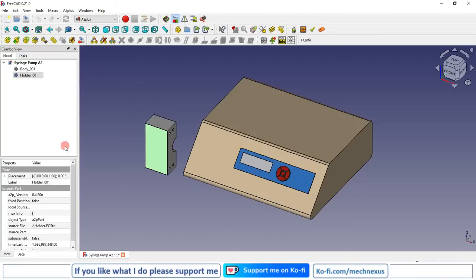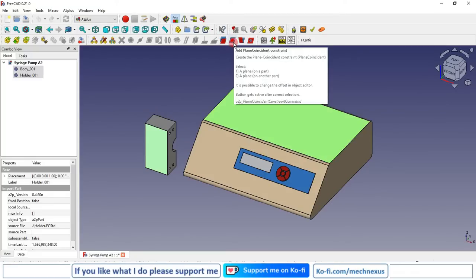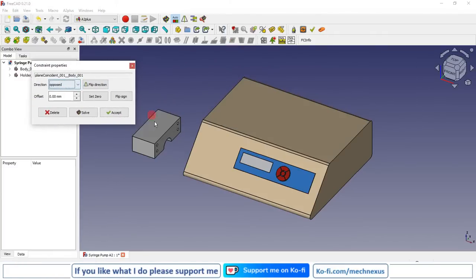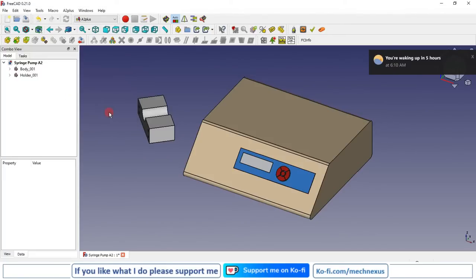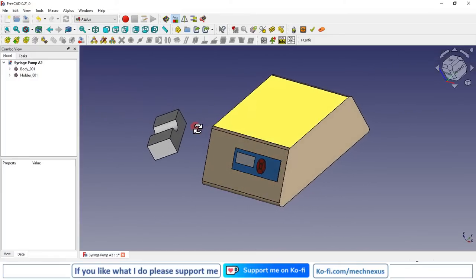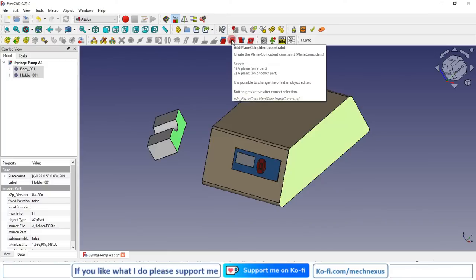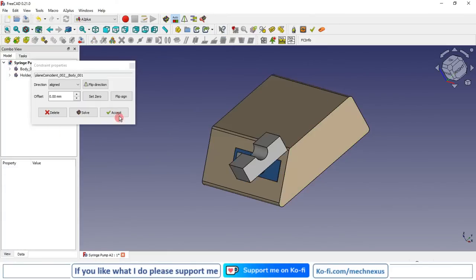So press the control key, select the bottom face and the top face of the body, and once you select on the two faces, FreeCAD will show you the possible constraint here. Now we will select this add plane coincident constraint. So you can see that constraint has been placed, but I want direction opposite. I will accept it. Now I will rotate my model by pressing roller and right side button of my mouse at the same time. Now I will select this face and this face, and I will place plane coincident constraint and I will accept it.